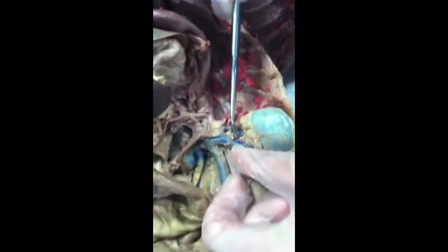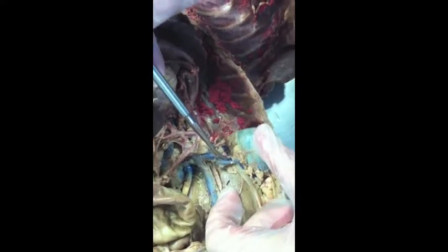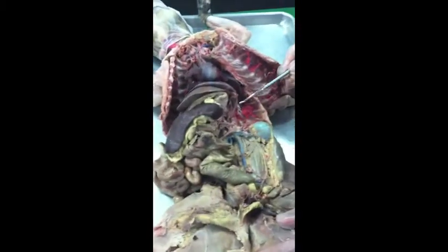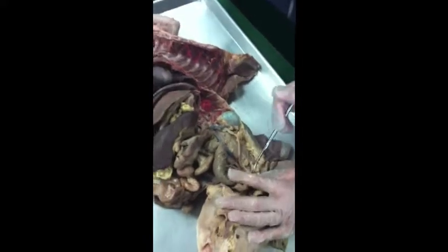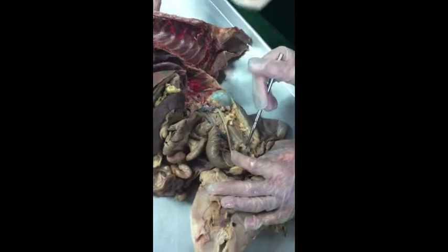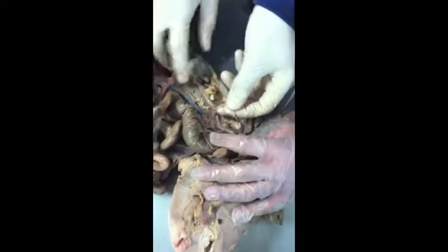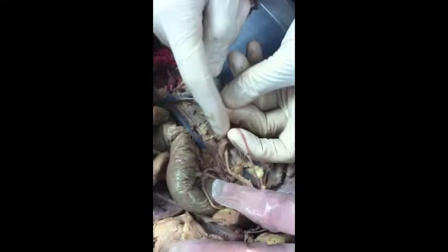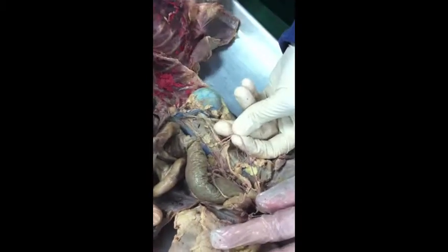Renal vein, and then the renal artery. So now we're going to the gonadals. The next thing we need is the spermatic artery or vein. It's going to be these tiny little guys here. This one, the vein got cut, but the artery is right here in my hand. So these are the artery and vein. If it's a male cat, then it's spermatic. If it's female, they're going this way to the ovary, and they're called ovarian.